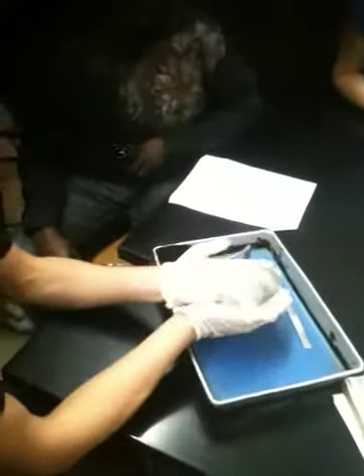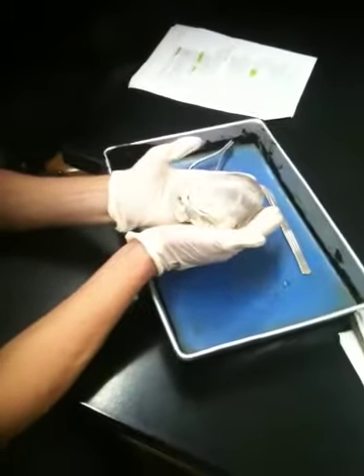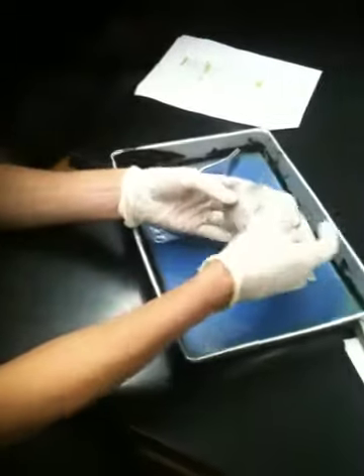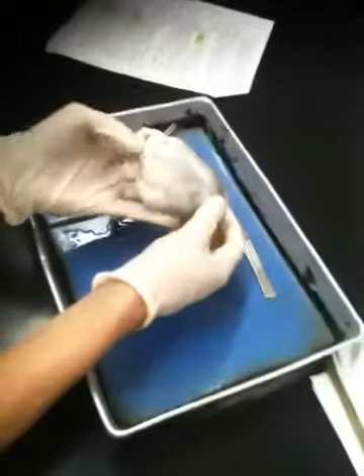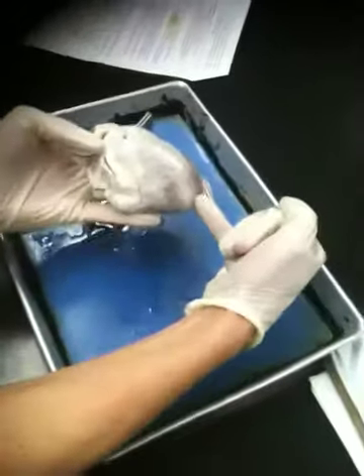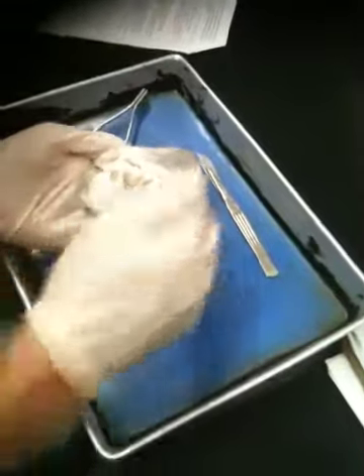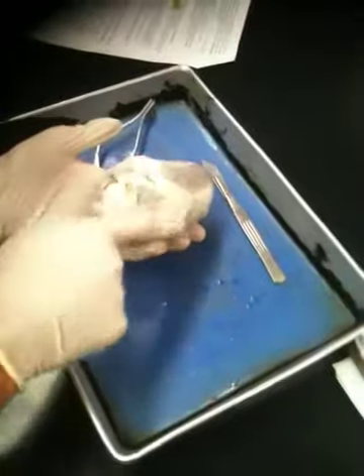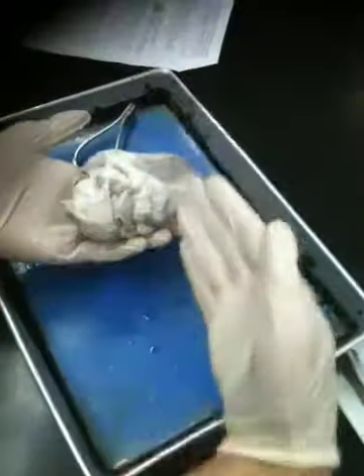The first thing when you're looking at a sheep heart here is that you always want to make sure you can orient yourself as to how you're looking at it. For example, notice how from this surface that I'm showing you right now, there seems to be a diagonal line going across that surface. Whereas when we flip to this side, there really is no diagonal line. If anything, the only implied line is maybe this fat tissue going transversely across.